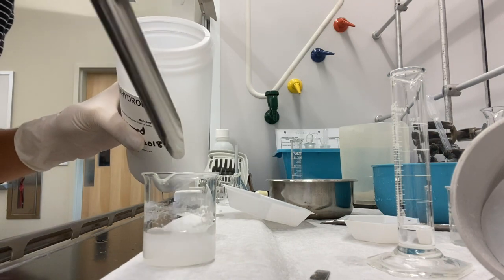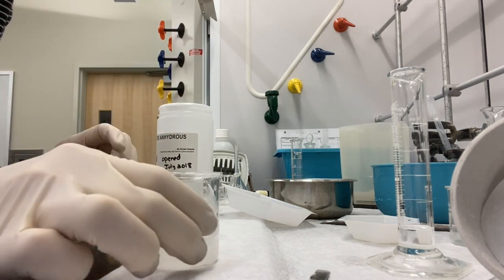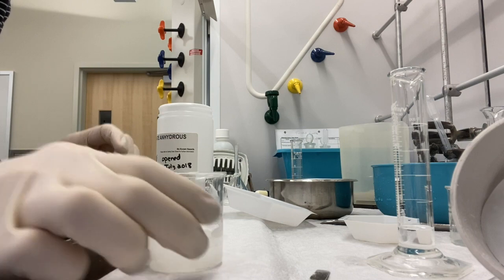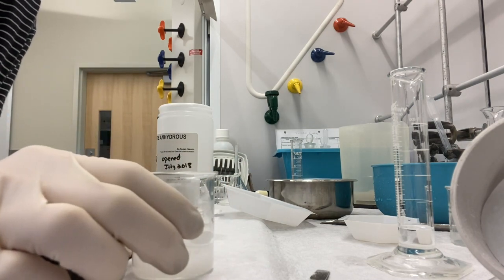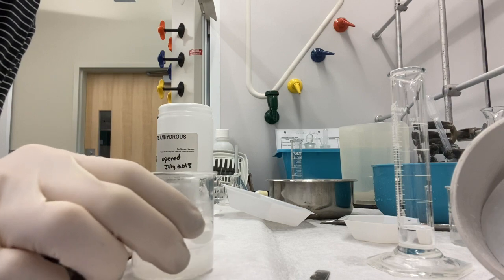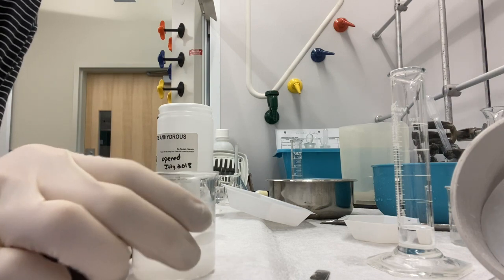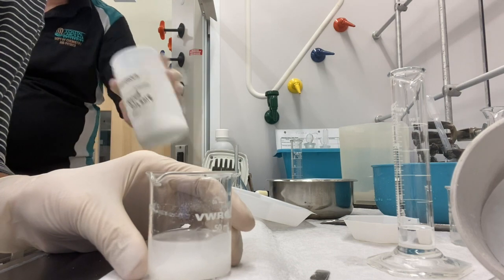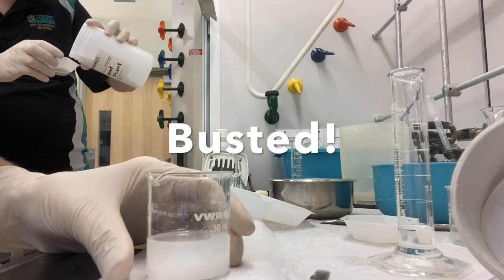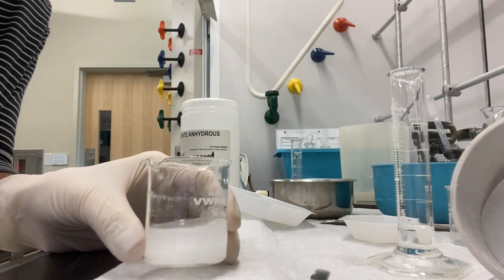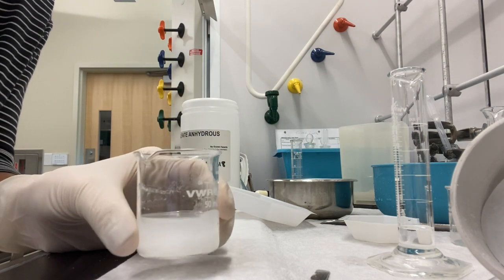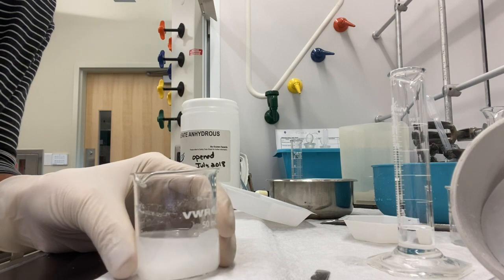And what we're hoping to see is that eventually our solution clears up because that water, which is kind of making the solution a little bit biphasic, is going to be soaked up in that solid and just leave behind a nice dry solution.